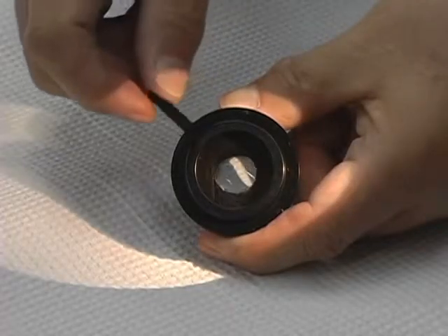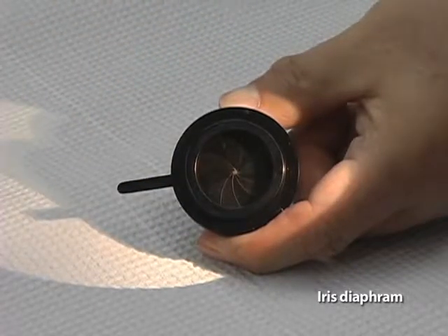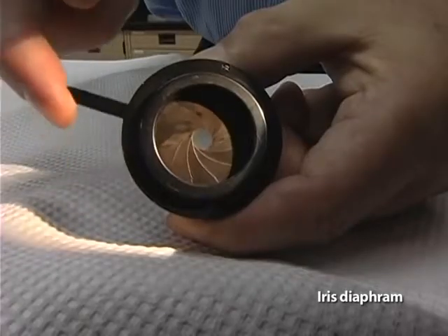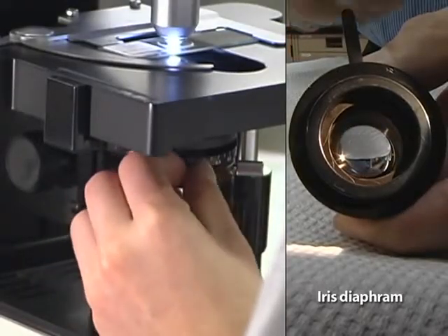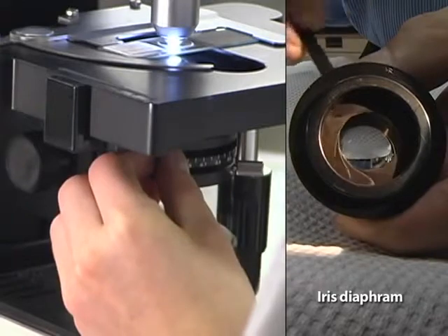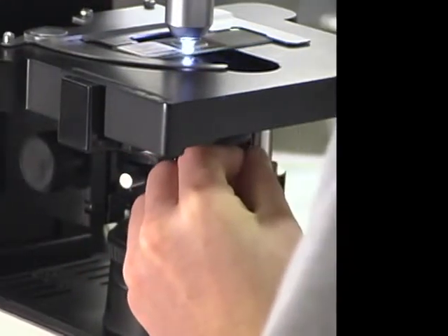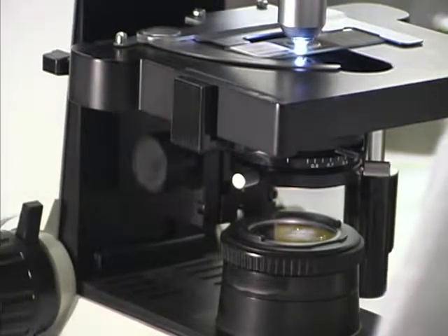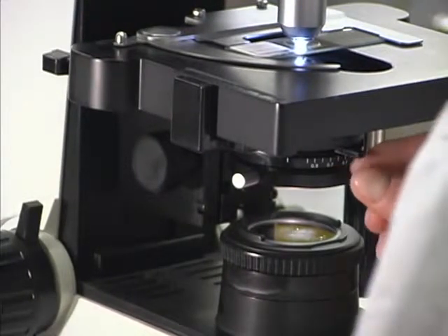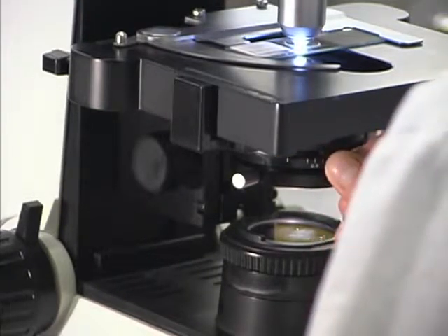Closely associated with the condenser is a device for limiting the diameter of light entering the condenser. The usual mechanism is an iris diaphragm. An iris diaphragm consists of a set of thin overlapping metal leaves that can be moved by a lever to form a continuously adjustable aperture. Generally, the iris diaphragm is opened more widely with objective lenses with higher magnifications. Closing the iris diaphragm increases contrast.